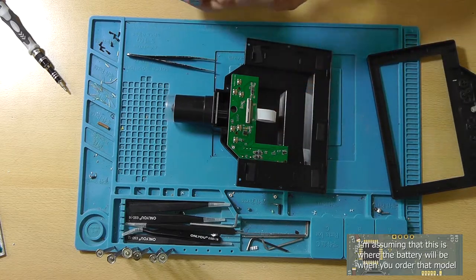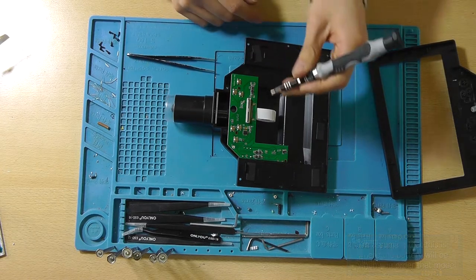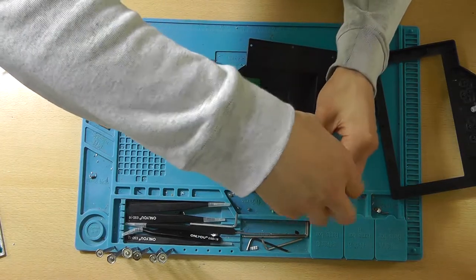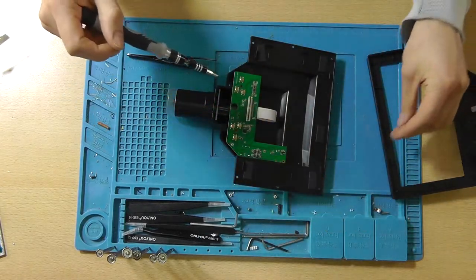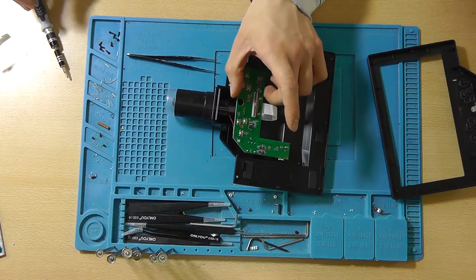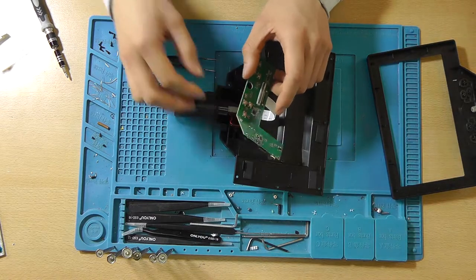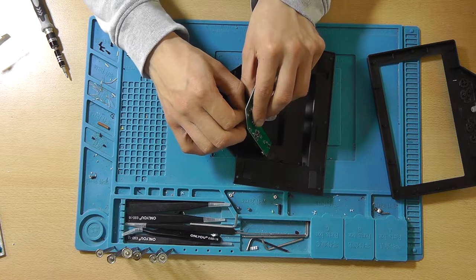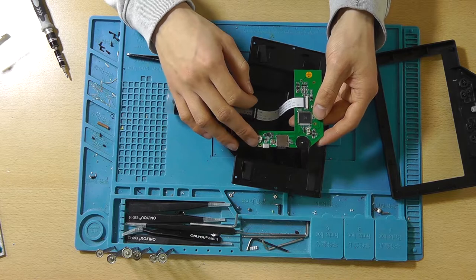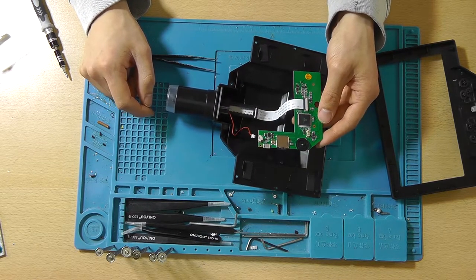But first we need to figure out where the actual battery connectors are. I'm assuming that they're on the bottom. So let's remove the board. Yes. Let's disconnect the flashlight over here. There is your battery terminal. And yeah, that's the point we need to connect the battery to.